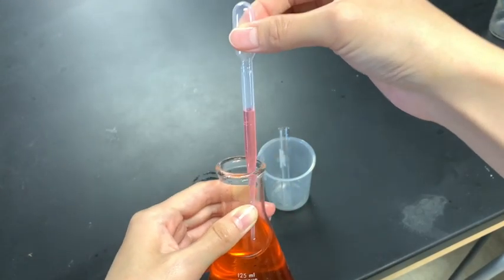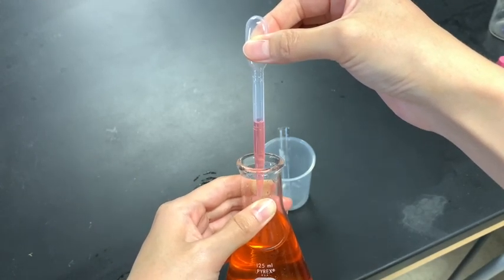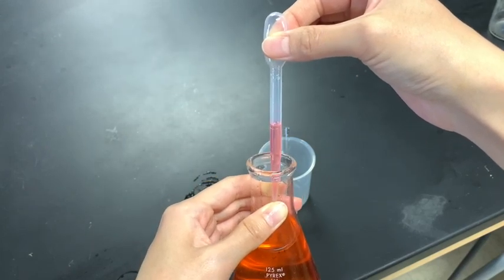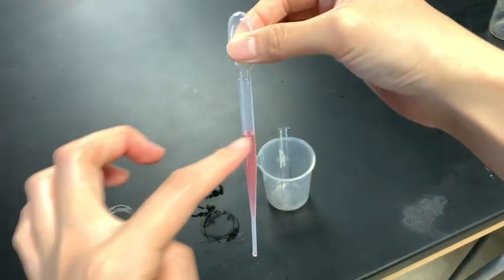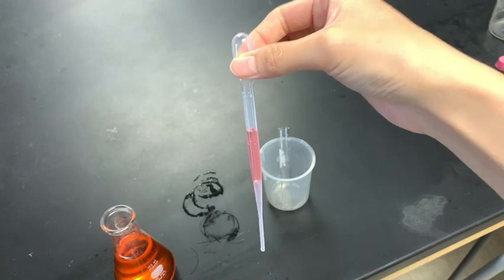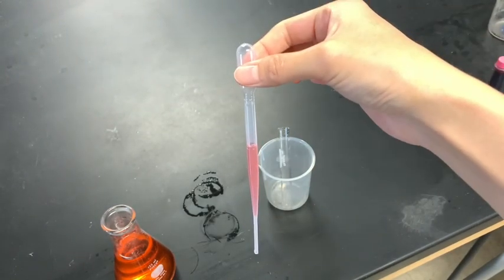And gently apply pressure on the bulb until the solution reaches the desired volume. Again, I want to measure out 1 milliliter of solution, so I can stop applying pressure here. That is 1 milliliter of solution. At this point you can let go of the bulb and this is still 1 milliliter of the solution.